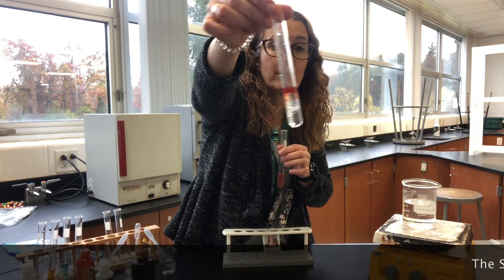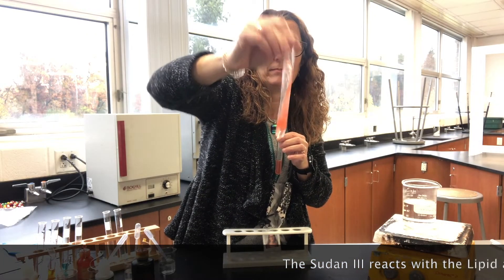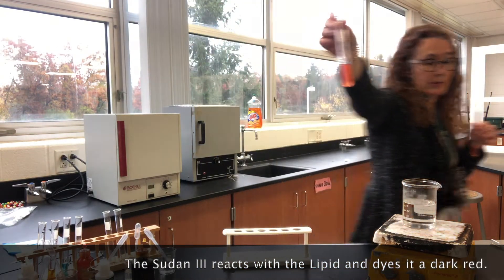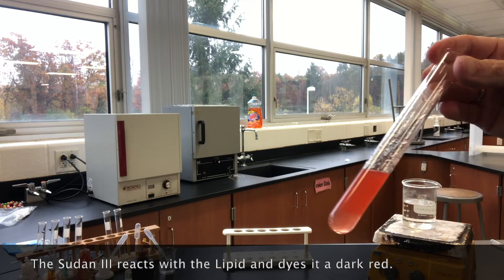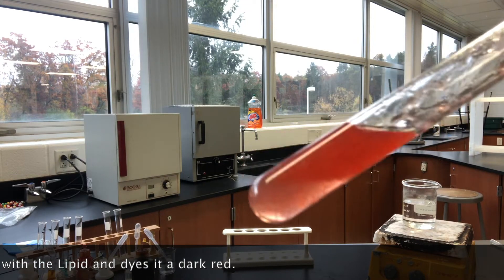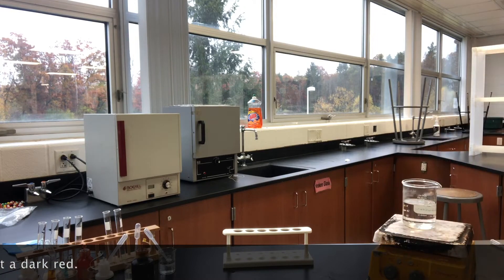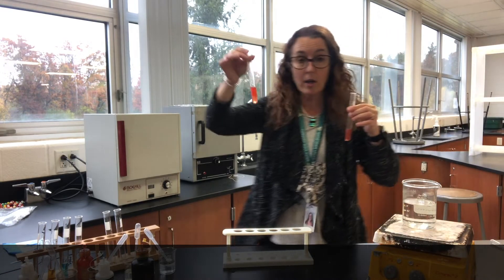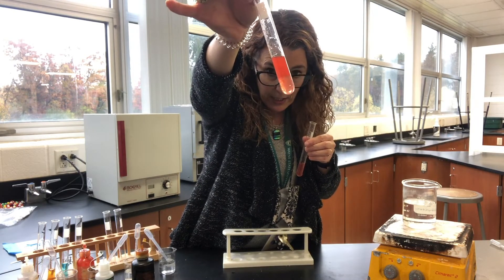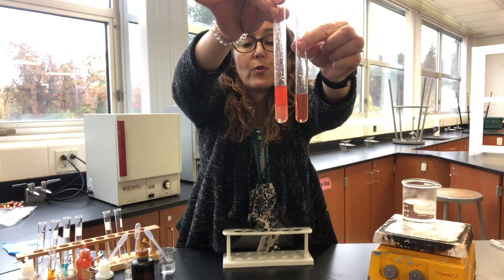On the oil sample you can straight away see there's a separation. If you shake it hard and come in close, you can see these globules getting coated with the red Sudan. A positive result is where the Sudan is coating the oil, whereas in the negative it's just dissolved throughout the water.